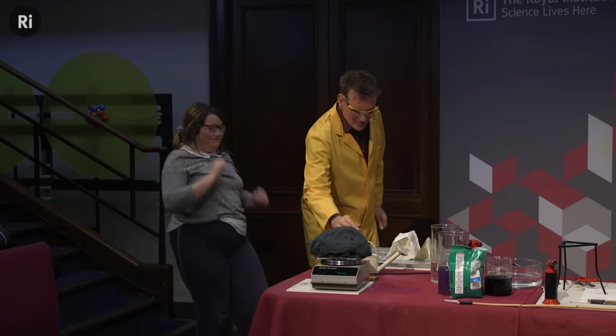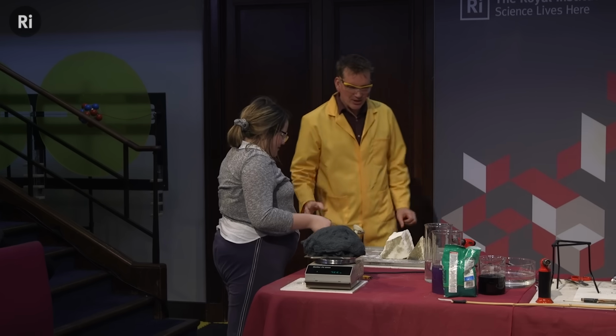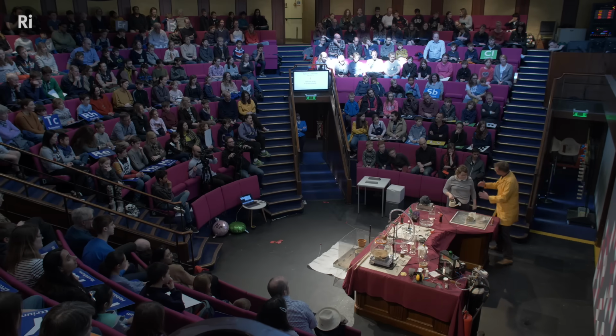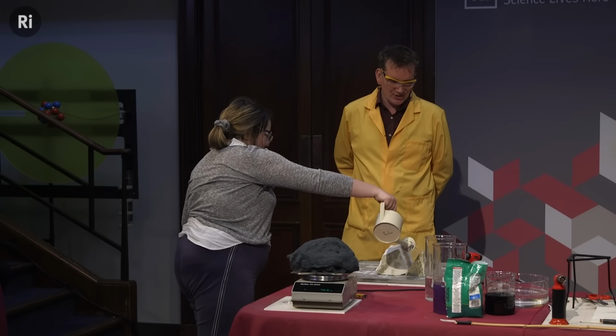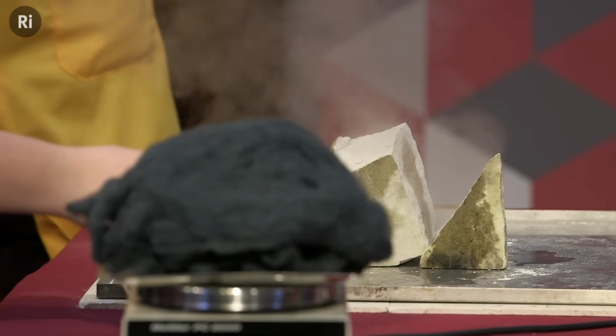Now, get a tiny little watering can there, if you don't mind picking that up without spilling too much of the water. And what I'd like you to do is to pour water all over this, just flood this, and then just step back a bit, just over to there. Okay? Thank you very much. So if you just pour water all over it, give it a good flooding all over both pieces. That's good. That's very good. Okay, and just step back. Thank you.